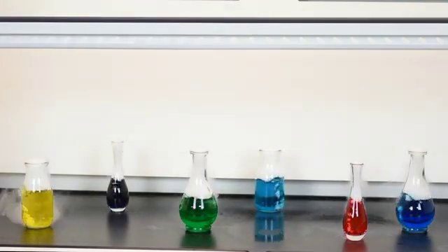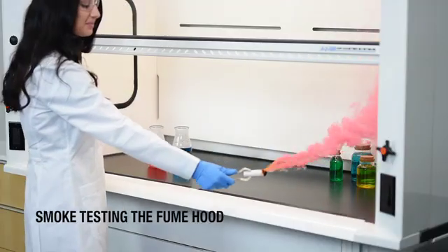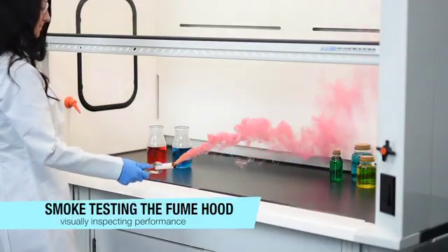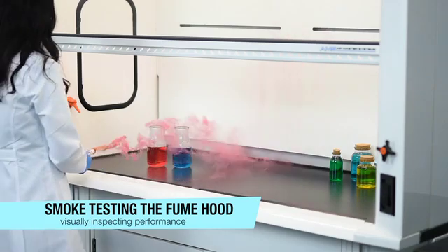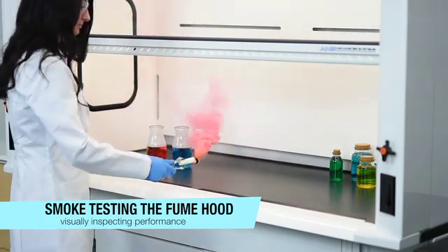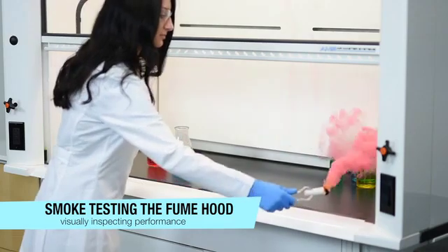Alright, now that we're safe again, let's move along to the next step. Alright, a visual smoke test is a great way to see how your fume hood functions. Now, as Marissa brings the smoke back and forth across the face of the hood, you can see that it's being drawn into the hood.